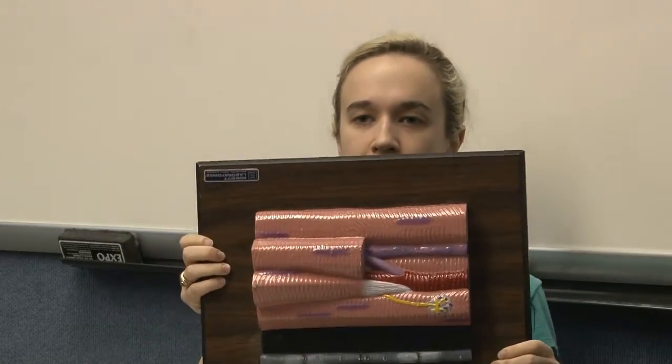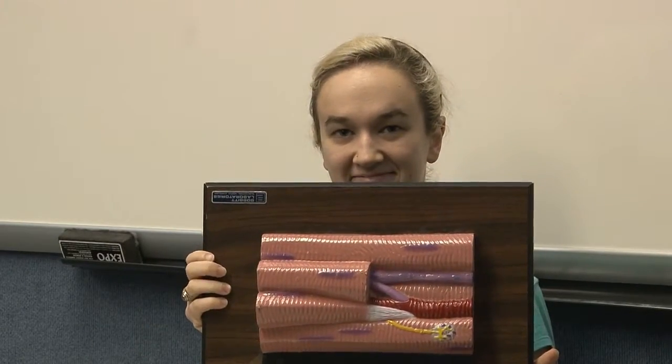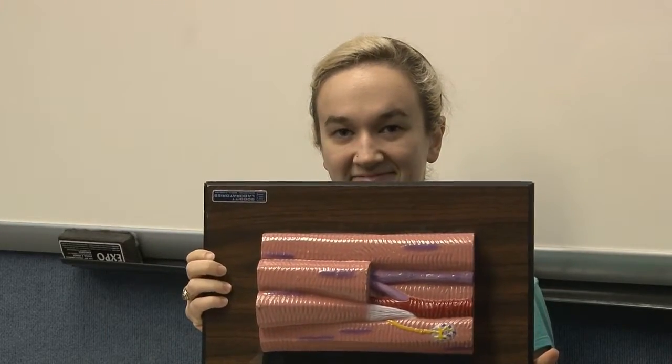The next one we have are skeletal muscle cells, where the nucleus is on the side, and they have little striations that you can see. We look at the end of one of those, and we can see that the nuclei are on the periphery, on the outside. And the black thing there is a blood vessel feeding that.